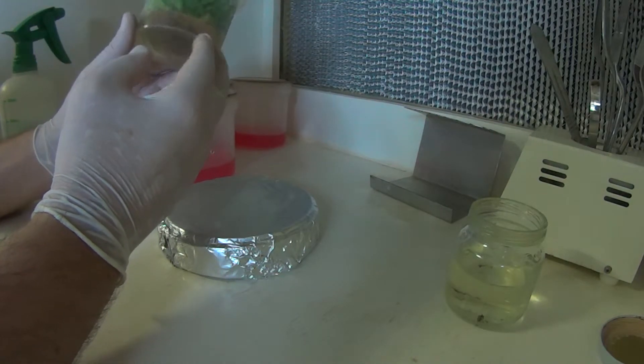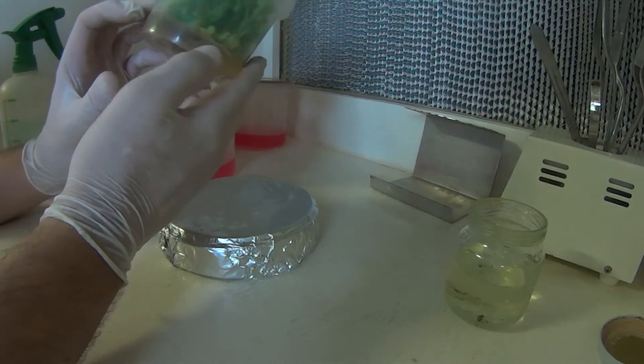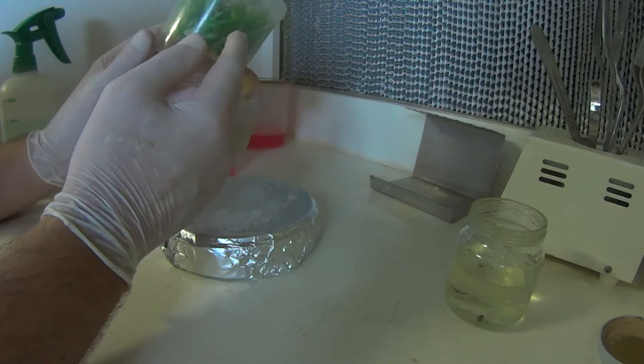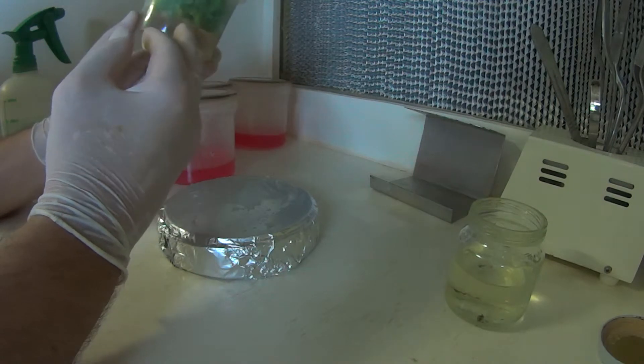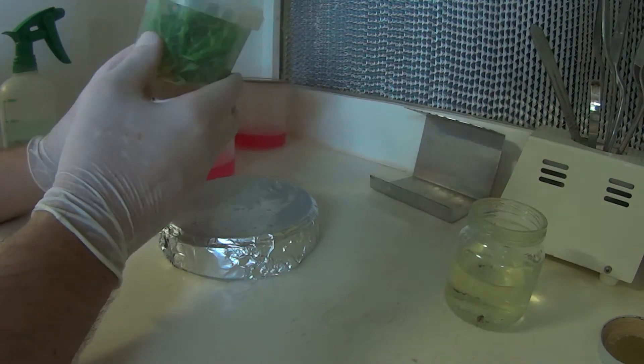Rather a large plant, probably several, maybe several hundred plantlets in there. I'm not going to keep them all, but what I'll do is go through and chop out some of the better ones and put them into rooting medium.